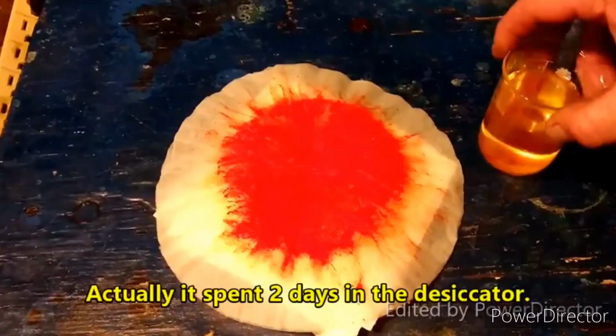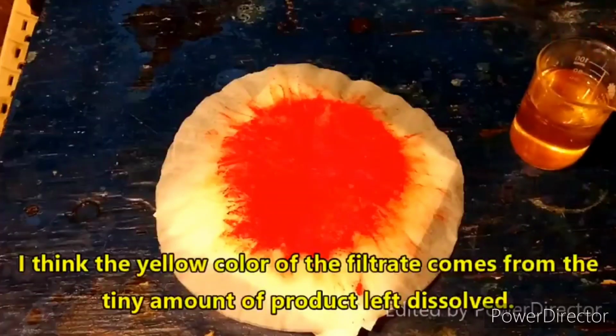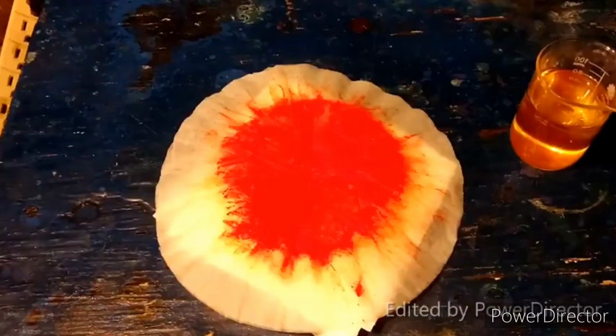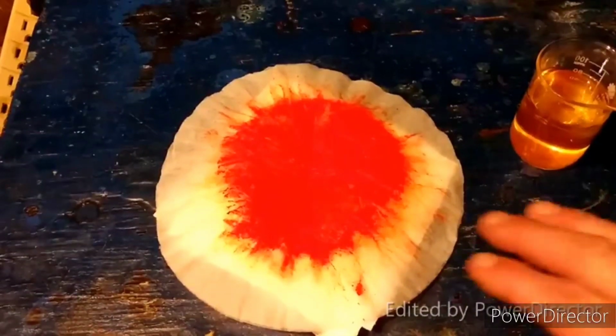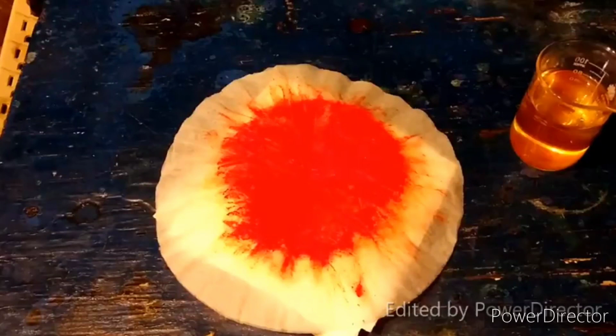You can see here, this is the filtrate. It has kind of a yellow color. I mean, we reacted stoichiometric amounts of stuff. I'm not sure what's up with that. Perhaps some portion of this is soluble, which would kind of match up with what I've seen before this stuff has dried out. If it's anything like the previous run I did, then it will dissolve in copious amounts of water. So, anyway, I'll come back in the morning when this is done.